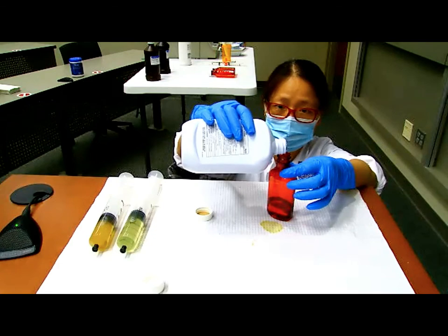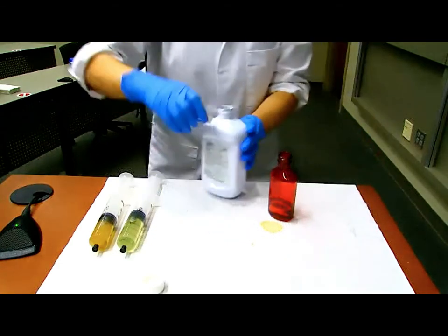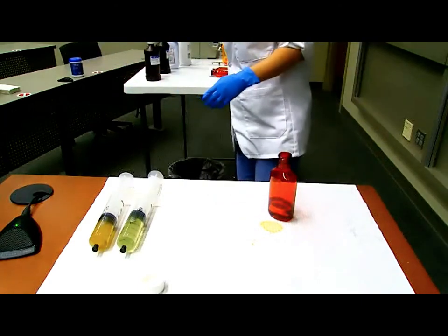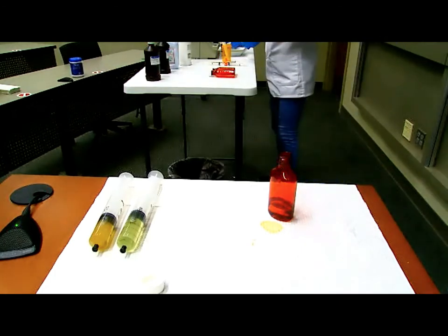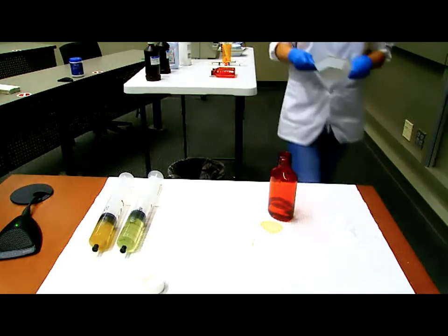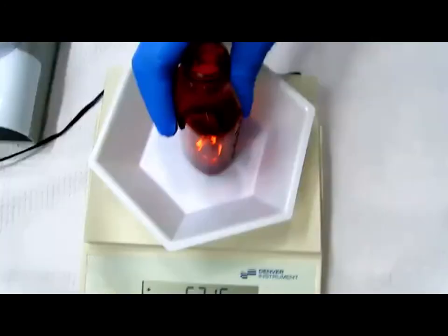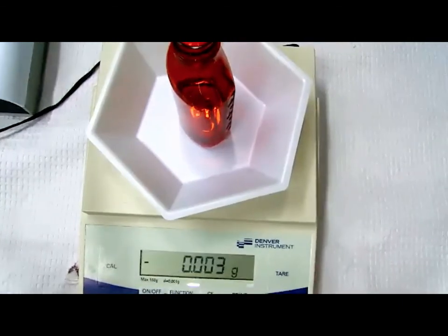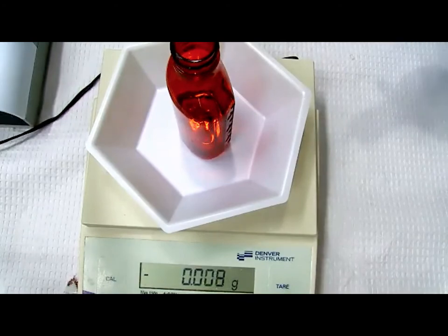So just pointing out, there are graduated marks on the bottle, and so you can use those so long as you are measuring to exactly one of those marks. You can't estimate between marks on a prescription bottle, but each of those actual markings are considered accurate. Even though I said that this is really cool because you don't need any equipment, you will see that the problem here is that when we try to add the emulsifiers, we're going to add them into the bottle directly.